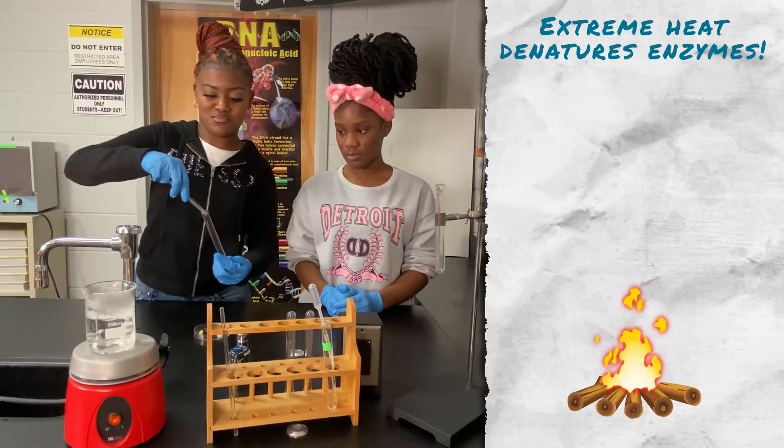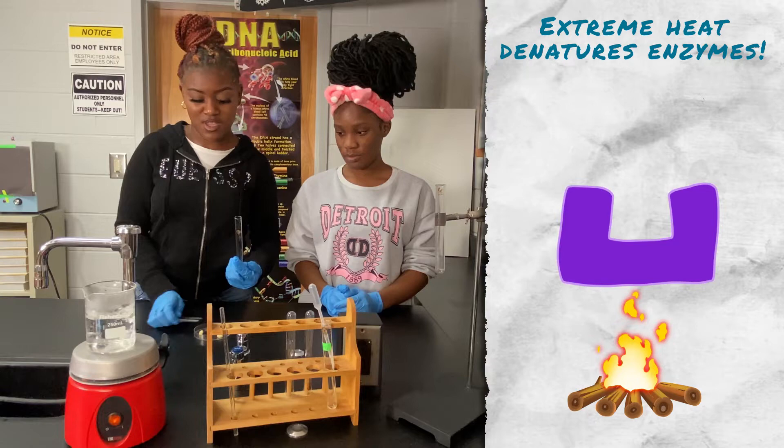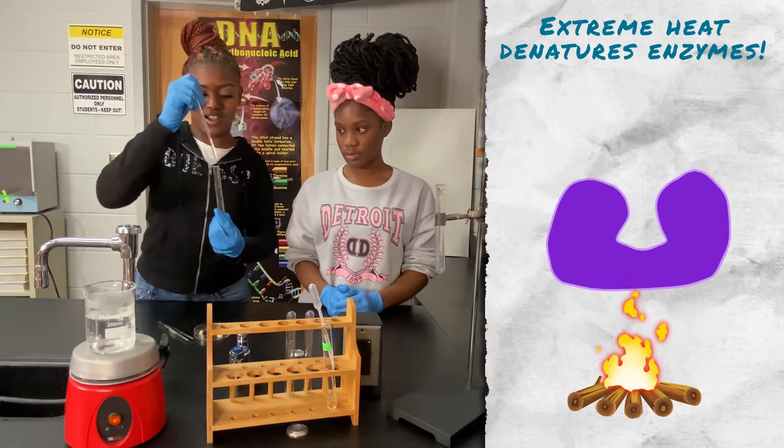Put the sample inside the test tube and make sure it's all the way at the bottom. If you can't get it to the bottom, use a glass rod to push it down.